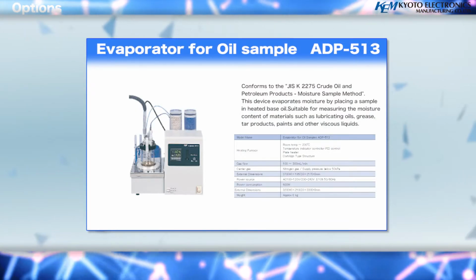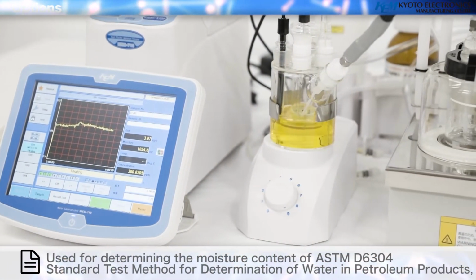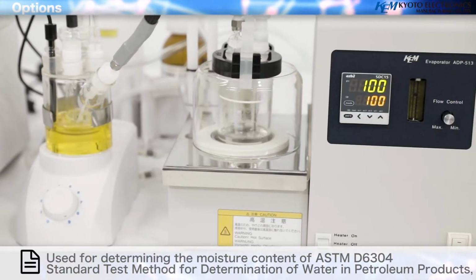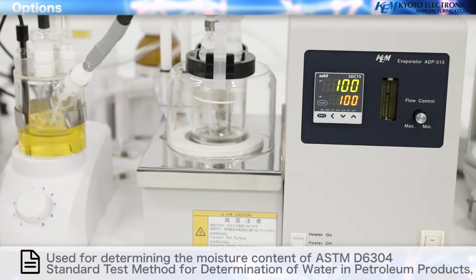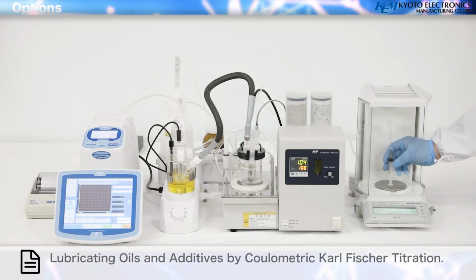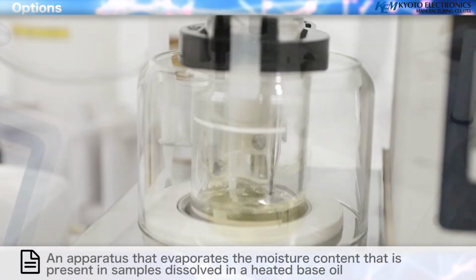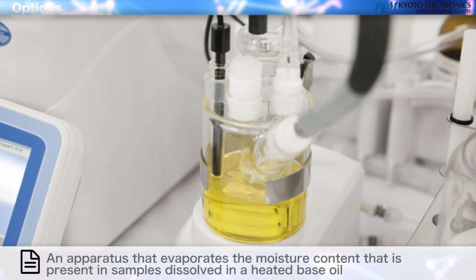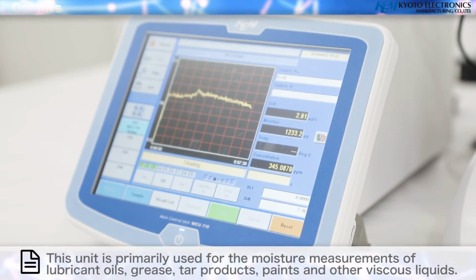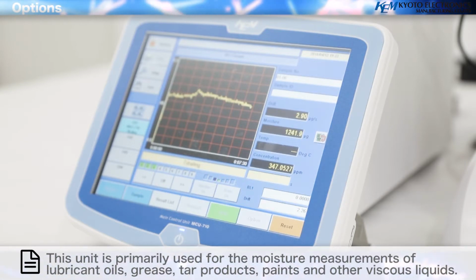Evaporator for oil sample, ADP 513, non-CE. Used for determining the moisture content of ASTM D6304, standard test method for determination of water in petroleum products, lubricating oils, and additives by coulometric Karl Fischer titration. An apparatus that evaporates the moisture content that is present in samples dissolved in a heated base oil. This unit is primarily used for the moisture measurements of lubricant oils, grease, tar products, paints, and other viscous liquids.